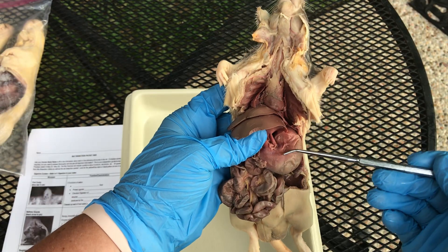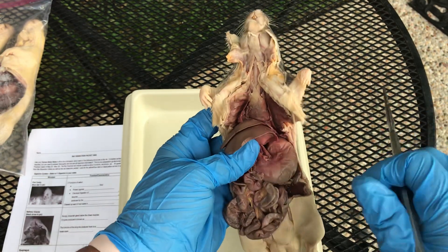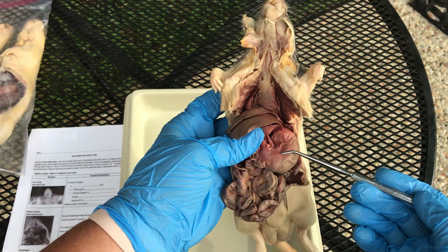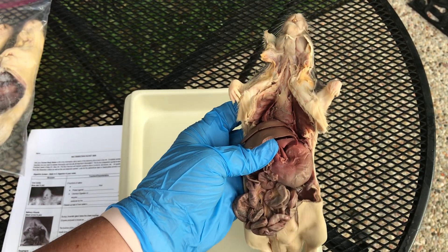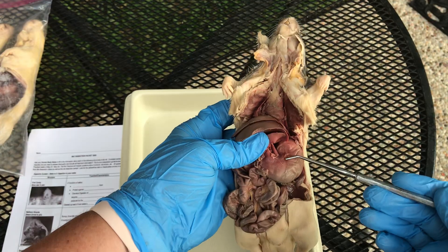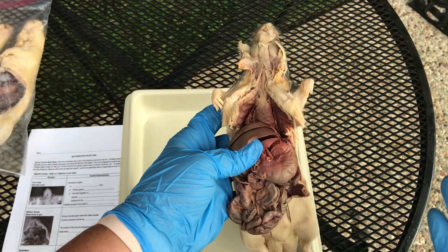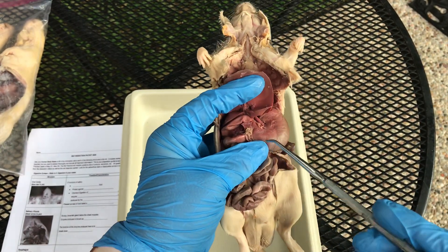The stomach's job is to mechanically break everything down again, just like chewing does, through churning — the smooth muscles squeeze and break down carbs, lipids, and proteins. Chemically, however, it only acts on protein. There is a special enzyme inside the stomach called pepsin that breaks proteins down into dipeptides and smaller polypeptides. At that point, the contents inside the stomach are known as chyme — it changes from solid food into chyme because it now has gastric juices and hydrochloric acid mixed in.